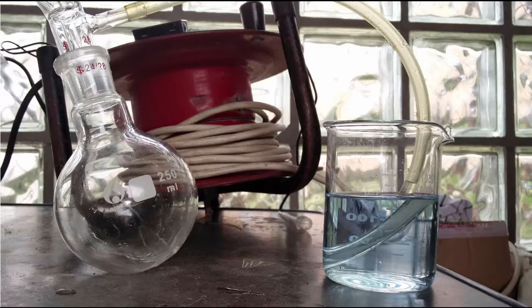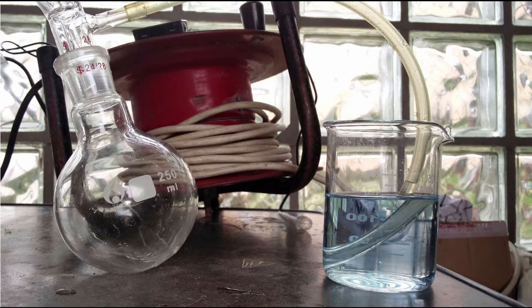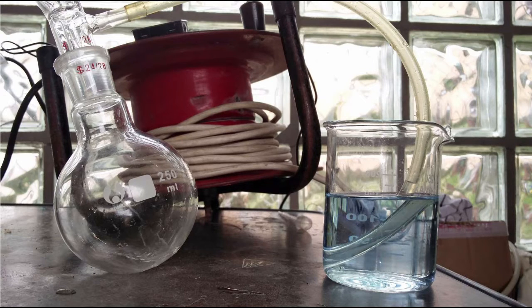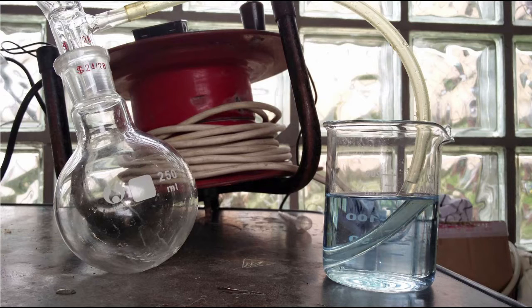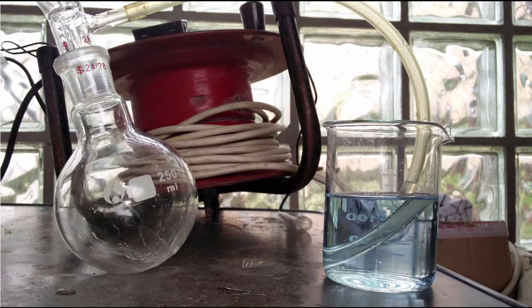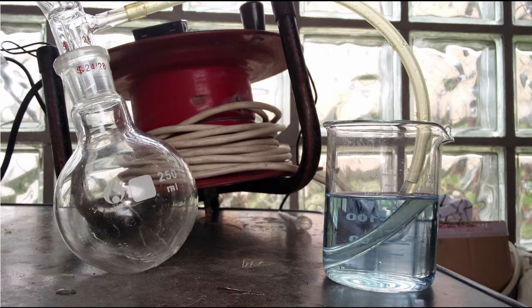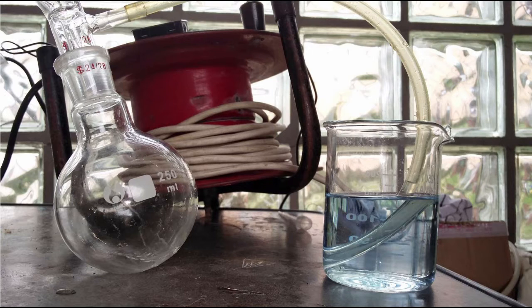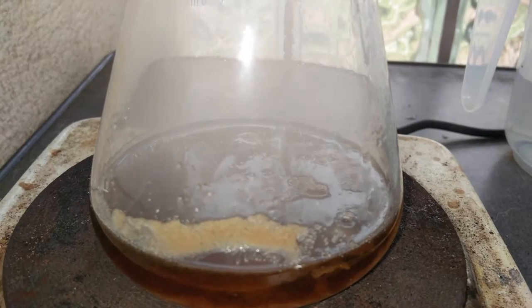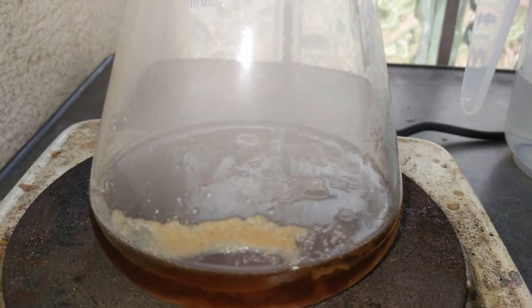I also attached a beaker with some sodium hydroxide solution, which is blue due to some bromothymol blue indicator. In this reaction, lots of CO2 gas will be released, so I want to react some of it with the hydroxide just for fun. It'll also help us tell when the reaction is over, because there won't be any CO2 anymore.